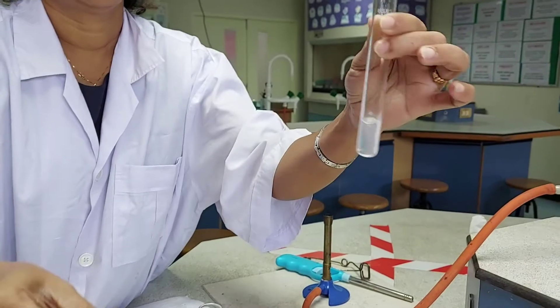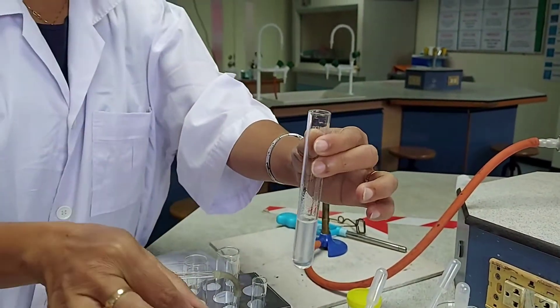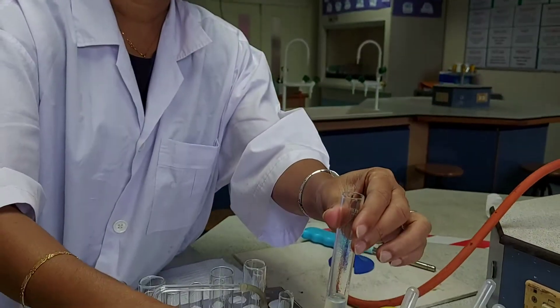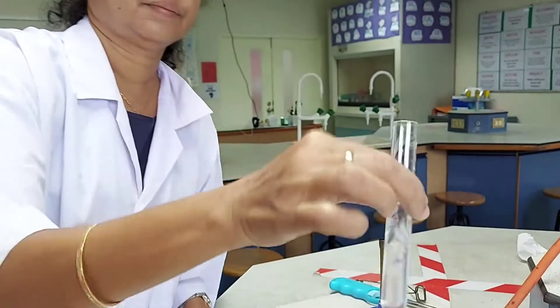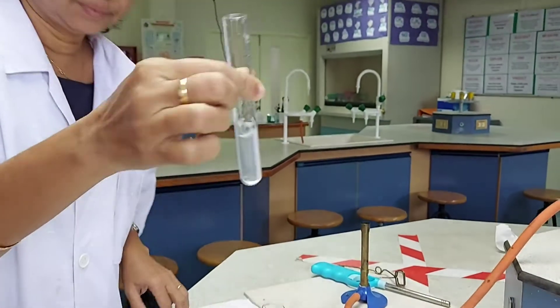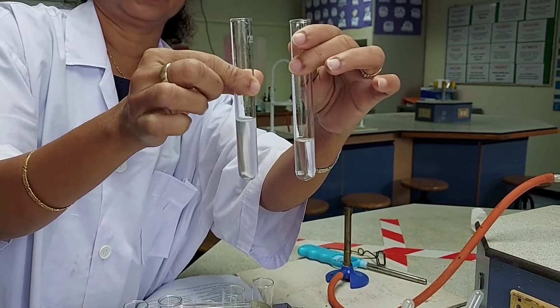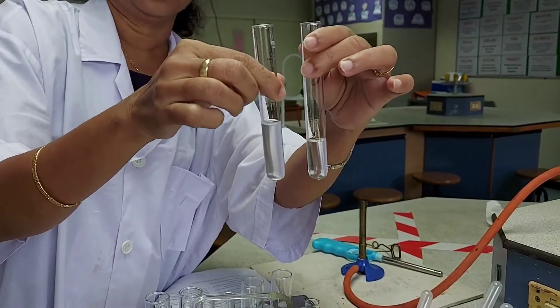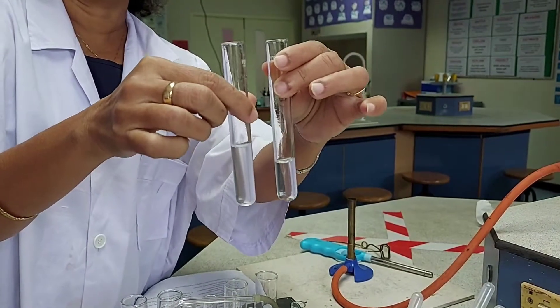Here the precipitate is dissolving but very slowly. Let me add a little more of the reagent to see if the precipitate is completely soluble. The precipitate is still remaining. In the case of sodium hydroxide, the precipitate has completely dissolved, but in the case of ammonium hydroxide, the precipitate is only partially soluble. So we can conclude that the metal ion present is aluminium — Al³⁺ — in this given solution.